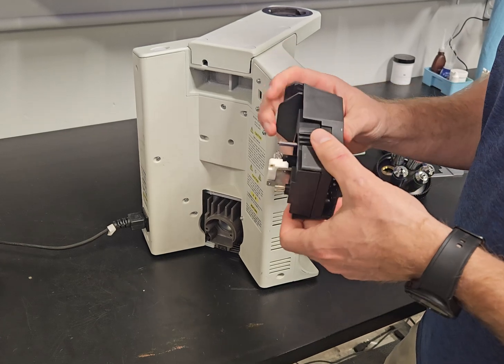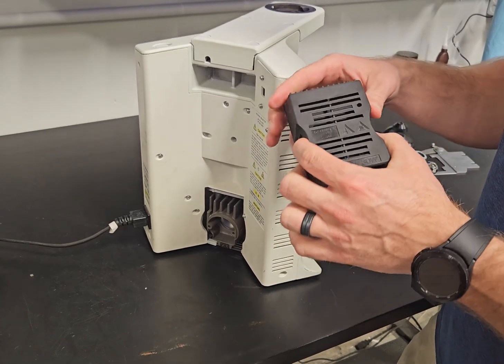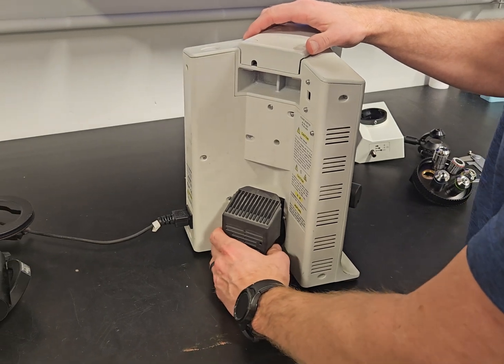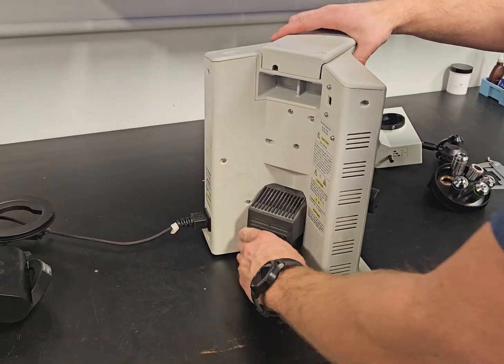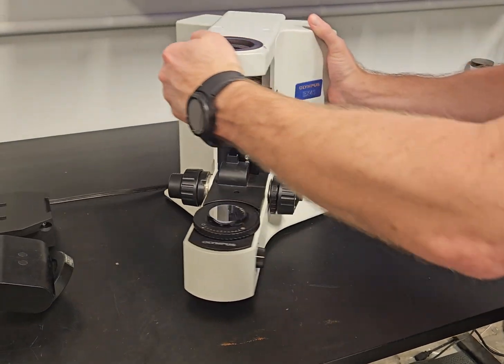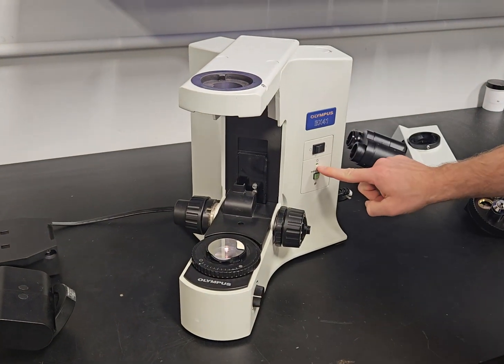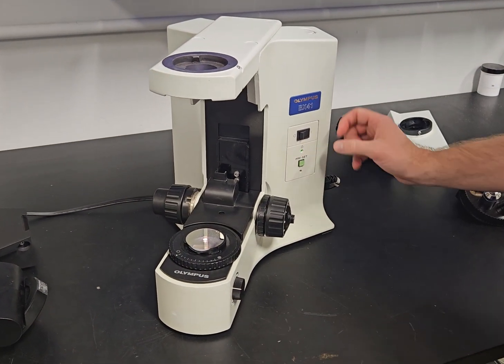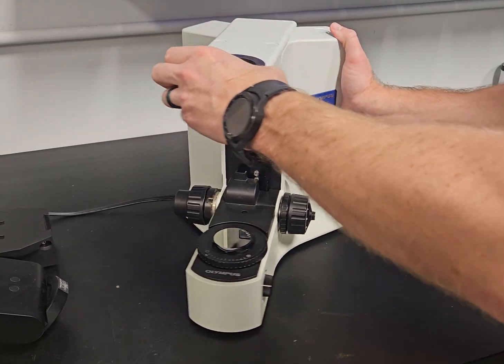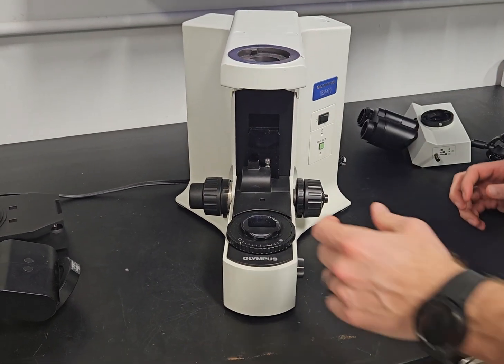These are great. They're like $54, 60 bucks. And if you ever go to your scope and you've just replaced the bulb and it still will not come on, but you turn the light switch on and that light illuminates, there's a good chance your lamp house is bad and needs to be changed. That's going to happen about every 10 years or so.